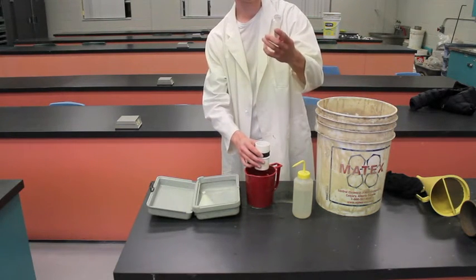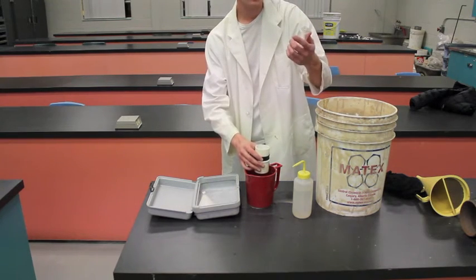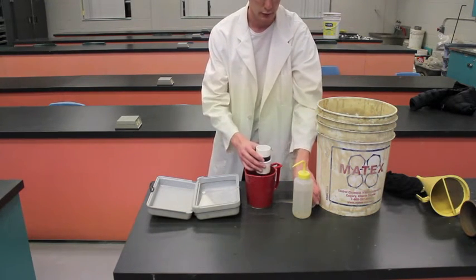And as you can see the quicker you did that, it took all our sand out of our vial there, so we have no sand left so we know everything landed on the screen.